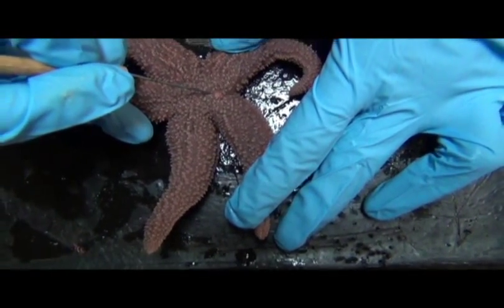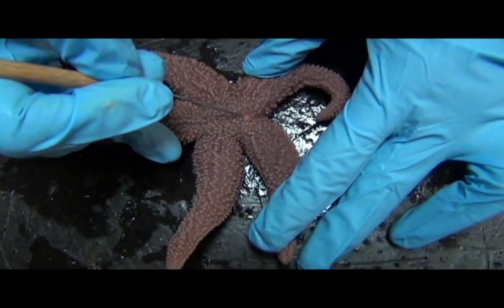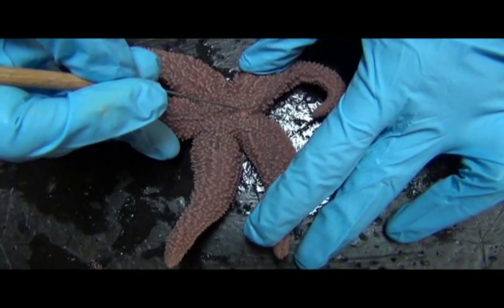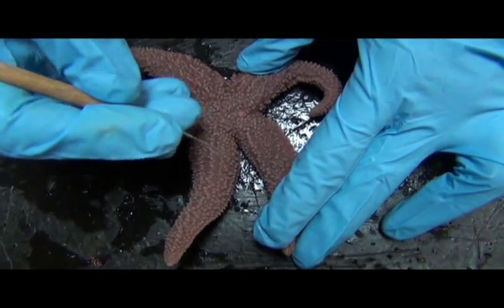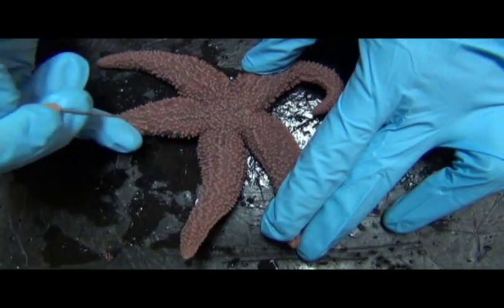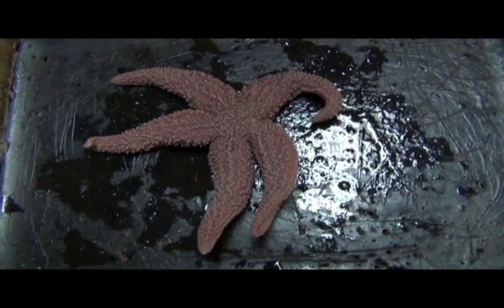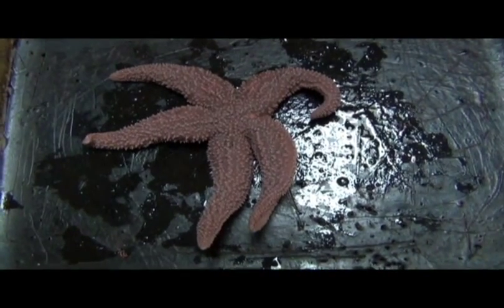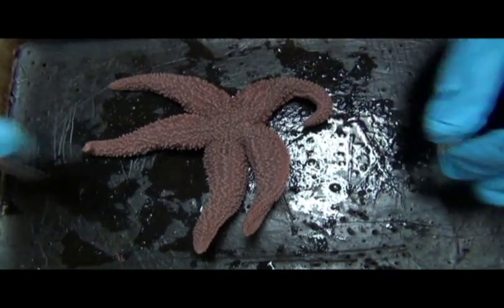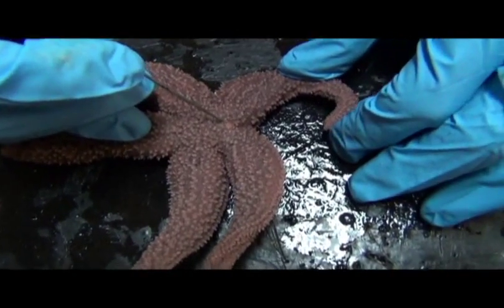You can think of it sort of as a kind of sink covering, in part because of how the animal itself is organized. You can think of the internals of the animal as a pretty fancy, sophisticated set of tubes within tubes, and overall a giant plumbing system. And this is the major in and out through which water can go in.